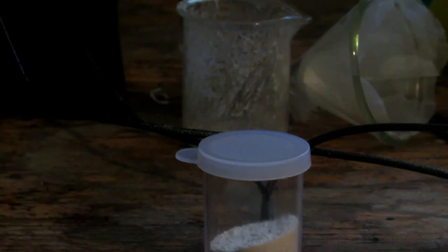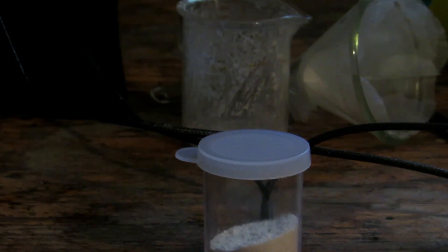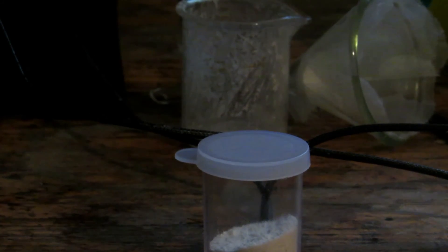I did prepare some lead nitrate and plan on doing a video by the dissolution of lead metal in nitric acid. Lead nitrate is quite toxic, so you have to be very careful - it can be absorbed by the skin and kill you. This reaction will be rather dangerous, but it should still be fun if you're safe.